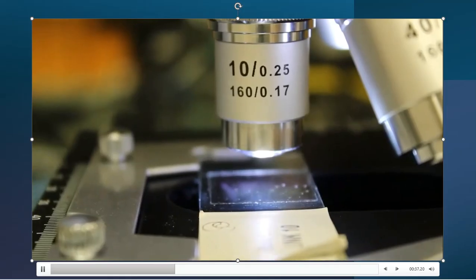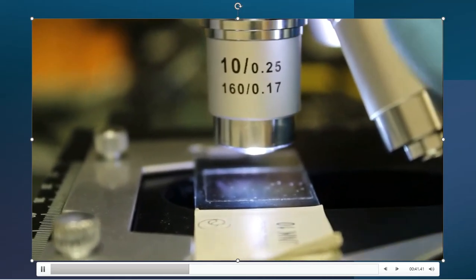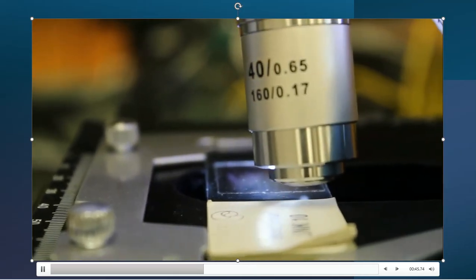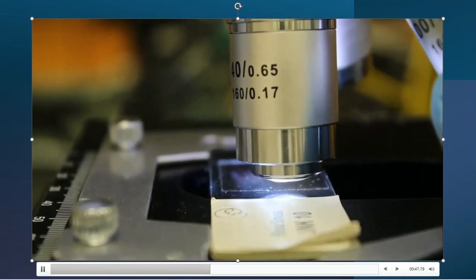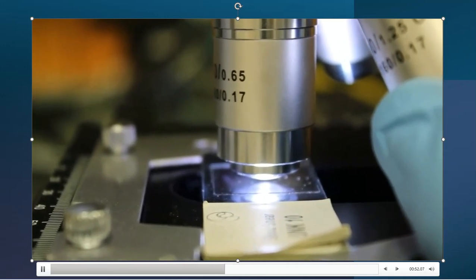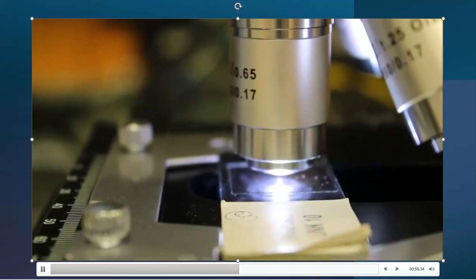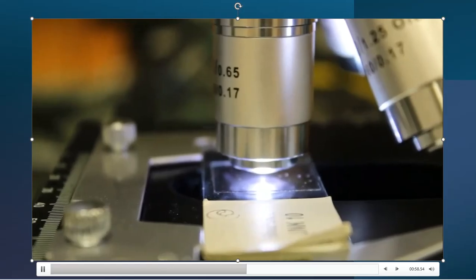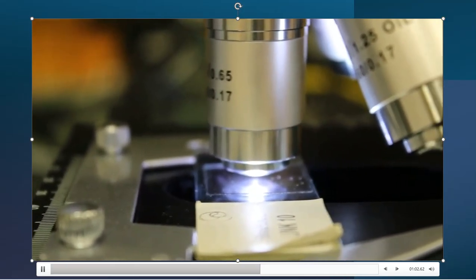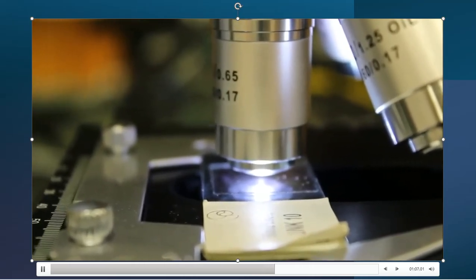So I'm going to lower that slide away from the lens a little bit, and then I'm going to turn until the 40, and oh god, barely above the slide. I mean, there is hardly any room at all. I maybe could put a little toothpick underneath it, but that's about it. So a little wood sliver, that is all that's going to fit there between that lens and that slide.